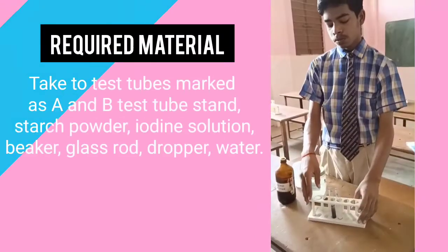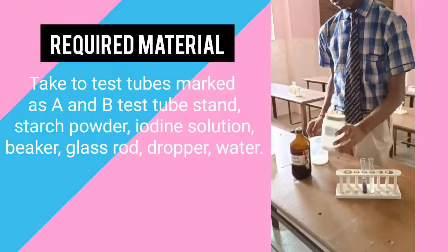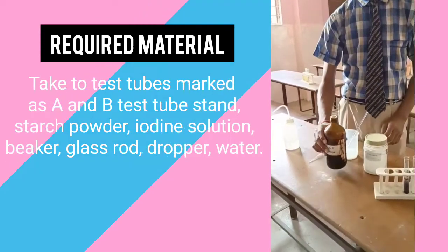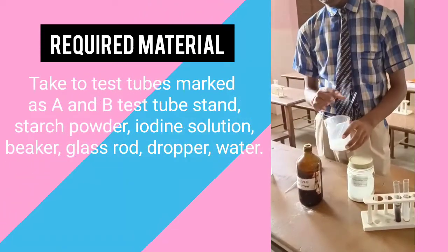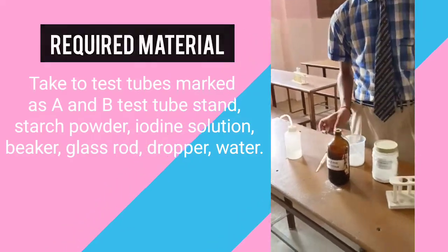Two test tubes marked as A and B, test tube stand, starch powder, iodine solution, a beaker and a glass rod, dropper and water.